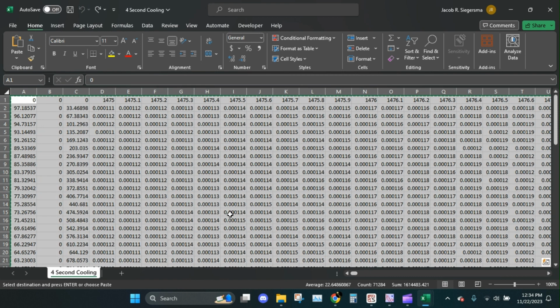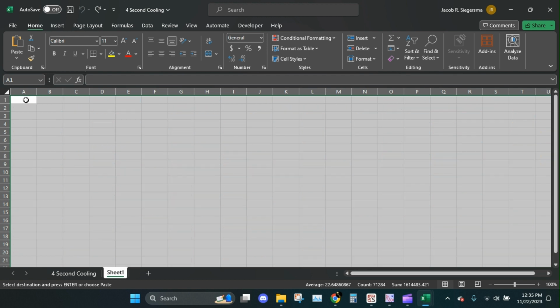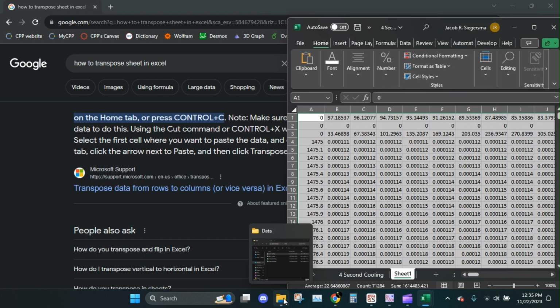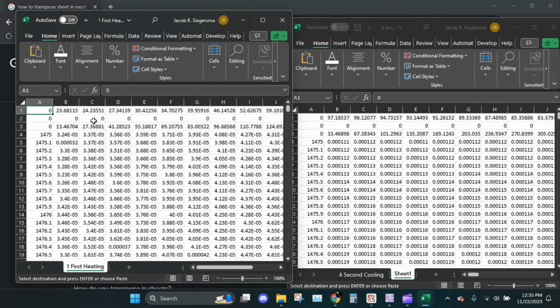Let's do that. Oh, how about we try a new sheet? That won't work because it's CSV. Paste the transpose. Thank you. Took me long enough. Okay. So that should now look like our other one. First heating. Yeah, temperatures, and then rows of zeros, and time, and wavelengths. Okay, so yeah, be sure to hit that stop and transpose button and not just halt the program. Okay?